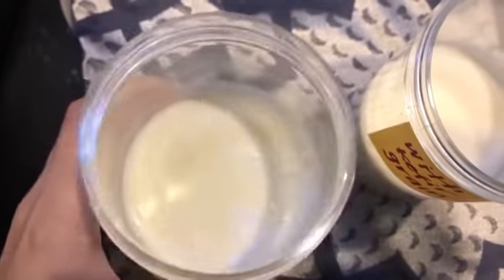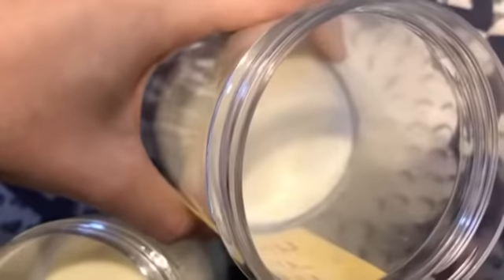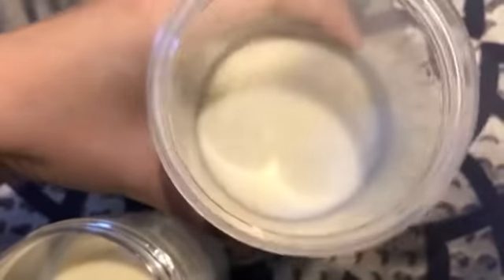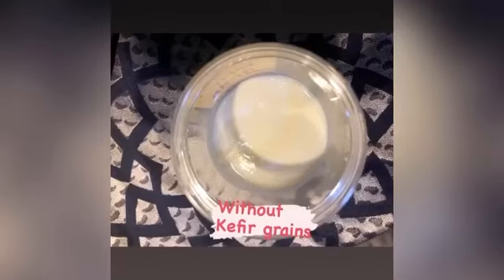There is yellow liquid formation on top of the milk without kefir grains. Meanwhile, the milk with kefir grains has coagulated. This is caused by the lactic acid bacteria coagulating the milk and inhibiting the growth of harmful bacteria. The taste of milk with kefir grains is also very sour, as lactic acid has been produced during the fermentation.